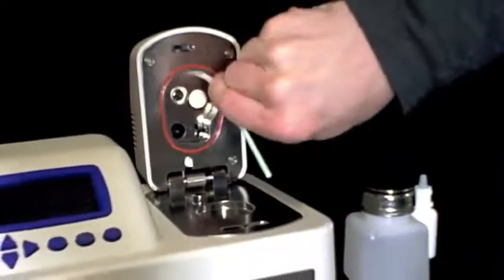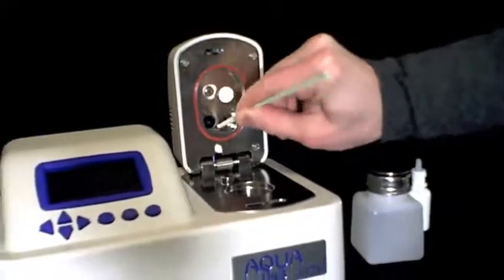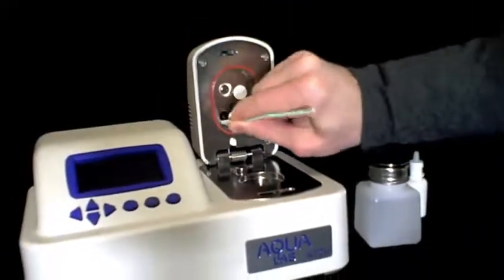Using the kimwipe with distilled water, repeat the cleaning performed in the first step, again making sure not to damage the fan blades.